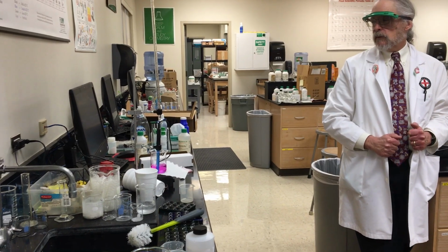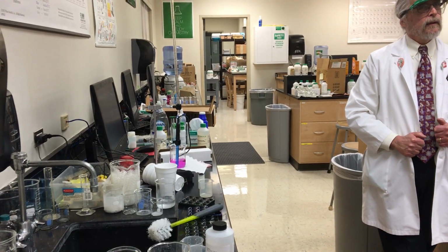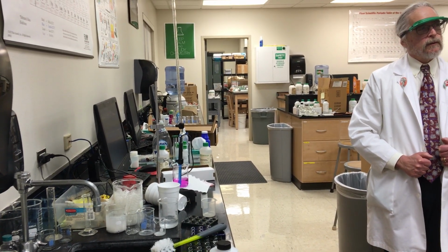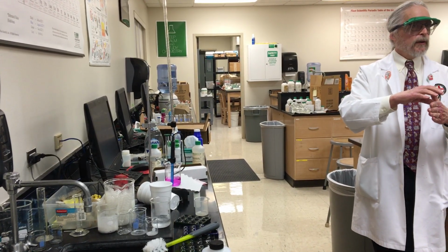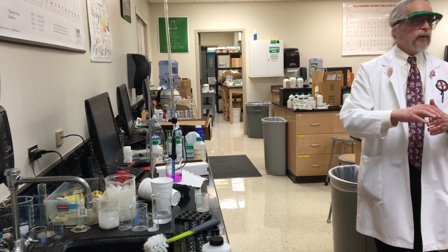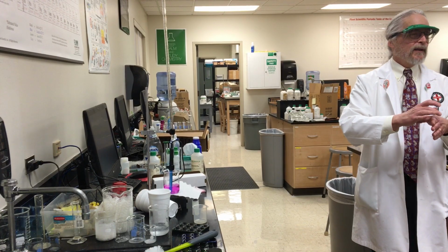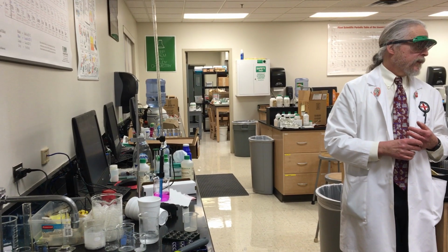Why would I want to start with acid in the beaker? Because it's a lower pH. Starts at the bottom, goes to the top. You can use phenolphthalein. If I start with acid in the beaker, what color was it? Clear. In a clear background, can you see a pink flash warning you to slow down? Yes. If it would have all been base to start with, what color would it have been? Pink. Would you have been able to see a clear spot in the middle of all that pink, or would the pink just have made it all look pink? Probably would just be pink. So you wouldn't get a warning, okay?